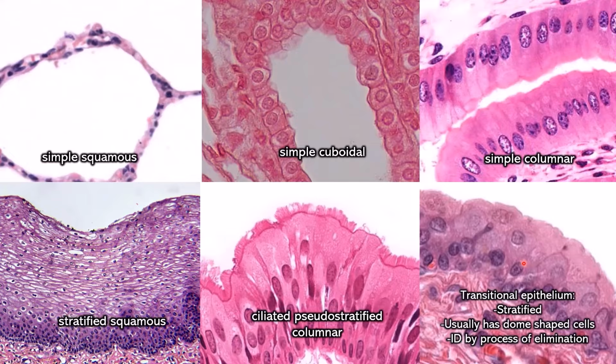And you want to ID it by the process of elimination. List all of the types of epithelium that you need to know in your head, and you can go right down the list and say, that's not simple squamous, it's not simple cuboidal, can't be simple columnar because it's stratified. And then when you think about the stratified ones, it doesn't have cilia, those aren't pancakes, and eventually you will come to the fact that it can only be transitional epithelium.